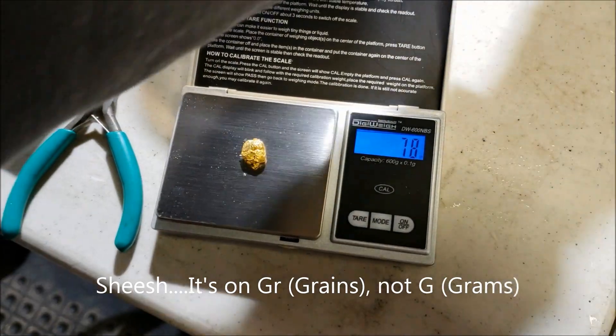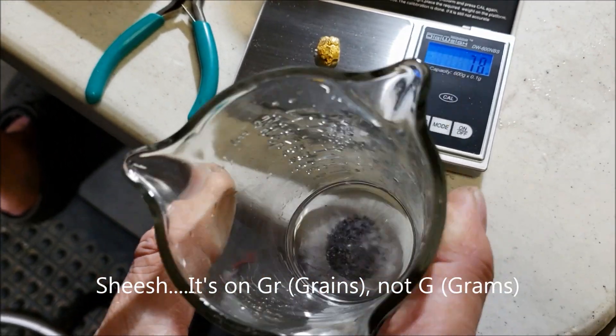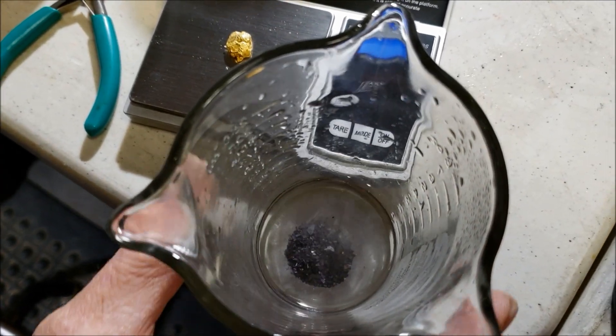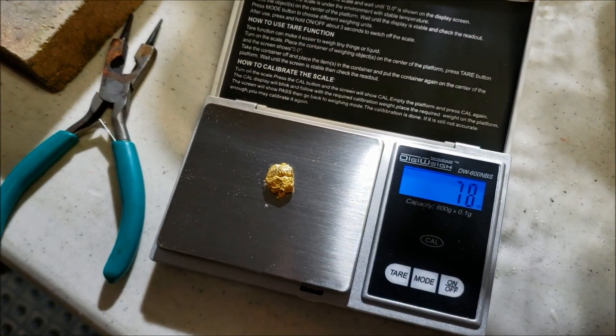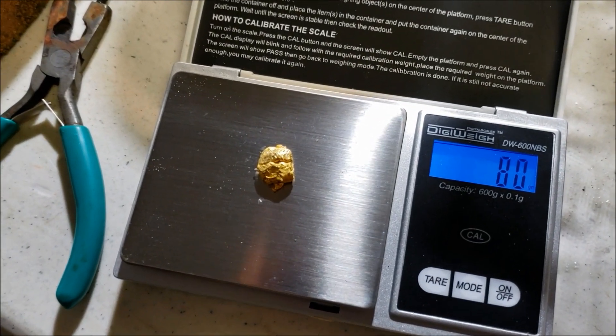But let me show you right here - this is what was in the gold which isn't gold. So you don't want it. Impurities at the front. But I still think there's some left in there, so I'm going to take that and run it through my next batch of aqua regia and get a little bit more gold out of it.